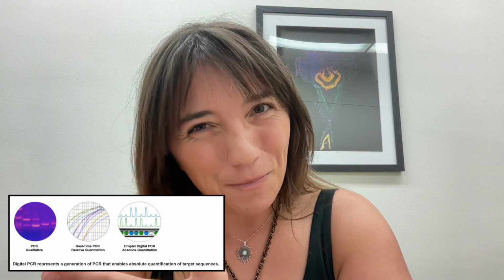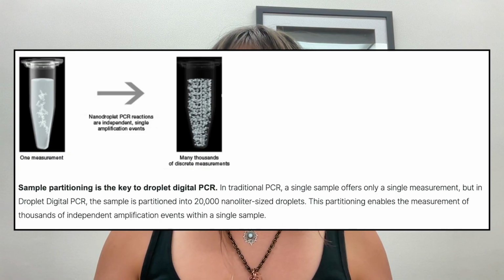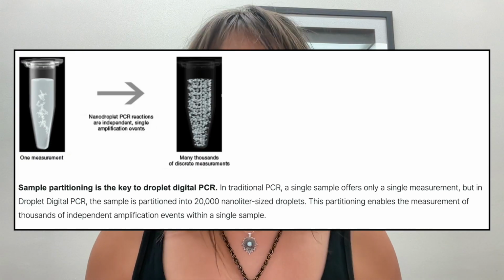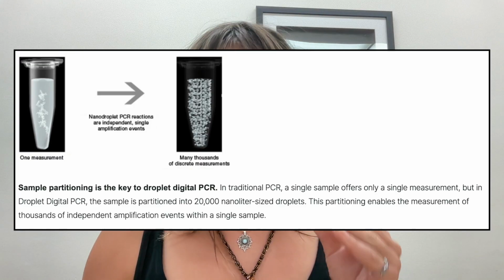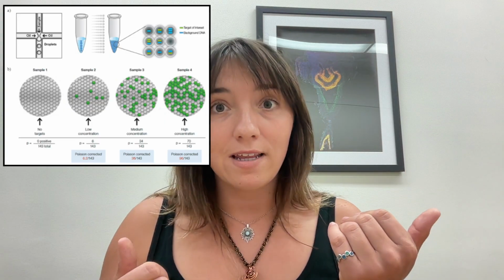So why ddPCR? ddPCR is extremely sensitive. It partitions your sample into tens of thousands of oil droplets. Each droplet acts like a teeny tiny test tube where an independent PCR reaction occurs. After amplification, these droplets are scanned one by one for fluorescence, telling us which ones are positive and which ones are negative. Using this data, we generate a Poisson distribution through which we can then back calculate the actual number of DNA copies in our sample.